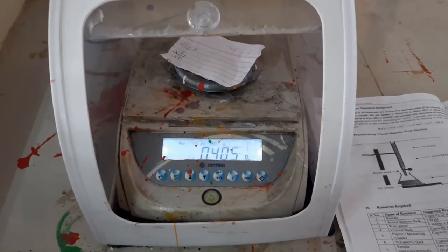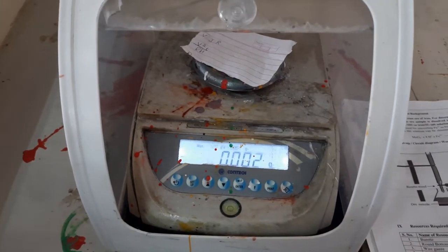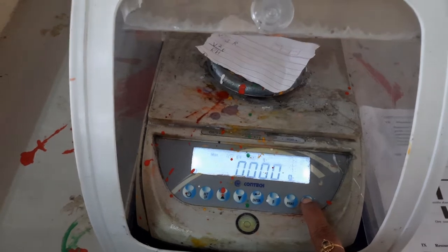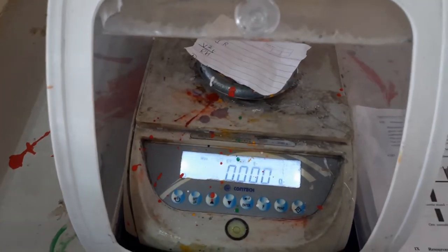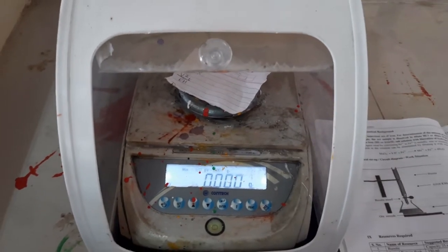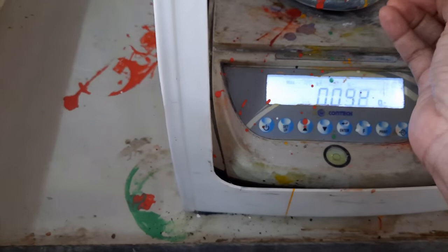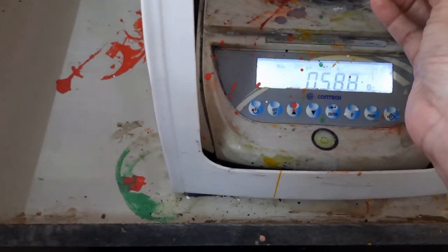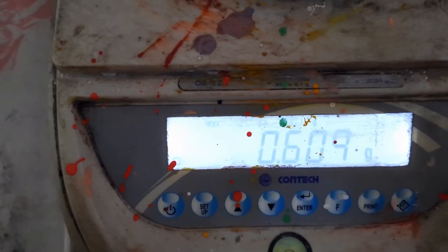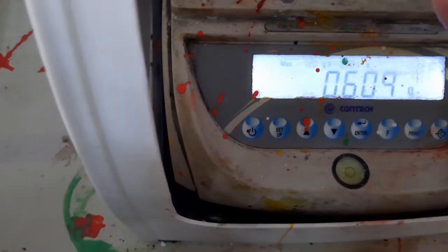Place the weighing paper on the electronic balance and press the tare button to set it to zero. Wait until the reading stabilizes. You have to take exactly one gram of hematite ore. Slowly add the powdered hematite ore until the balance reads approximately 1 gram. Here we have taken about 1 gram of hematite ore.